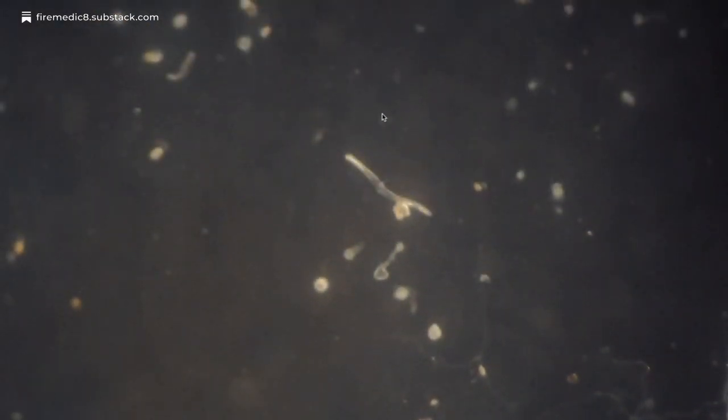It's like the dense particles that are up top. You can see that when these shimmer, so does the whole thing at the top. These are all woven in together. All these little particles are woven in together to these little anchor points here.